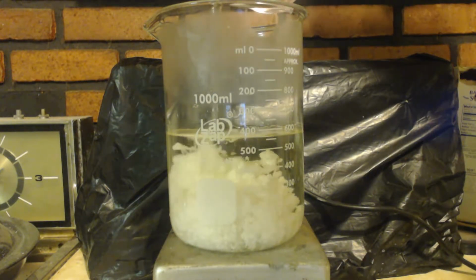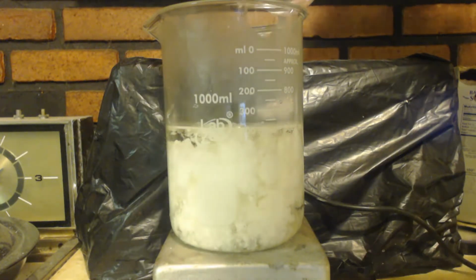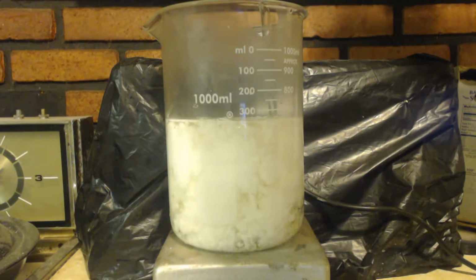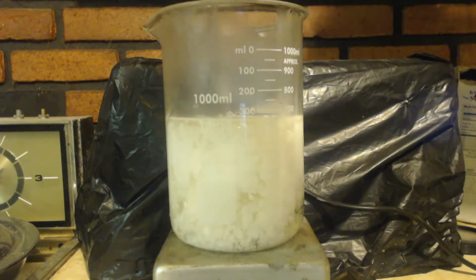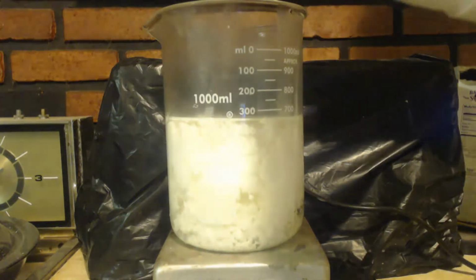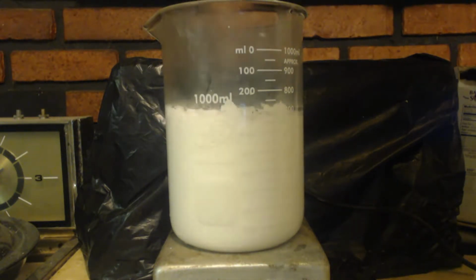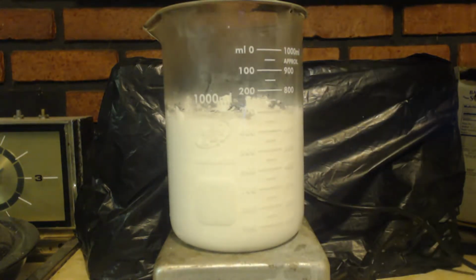See that? I'll stir that up. Make sure it all reacts. It's getting thicker and thicker.